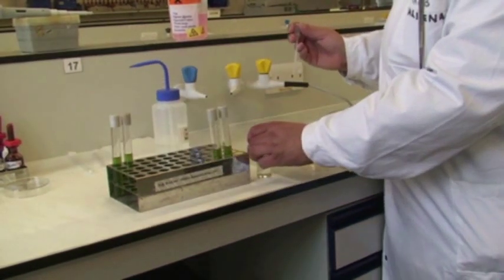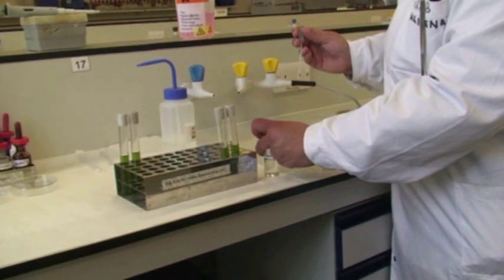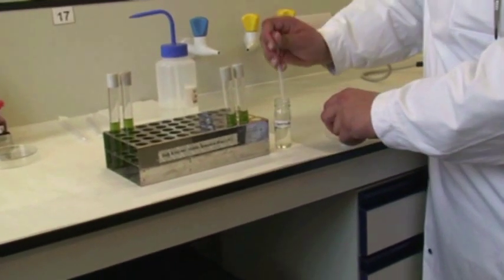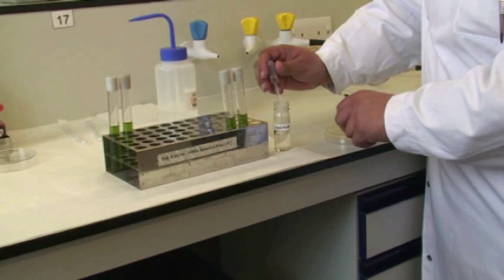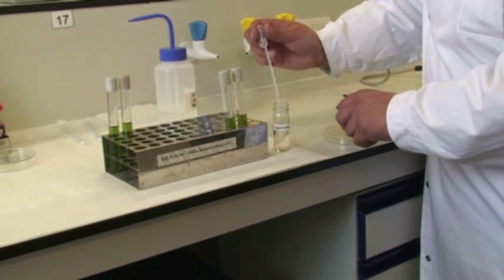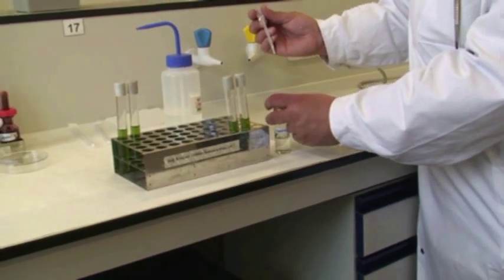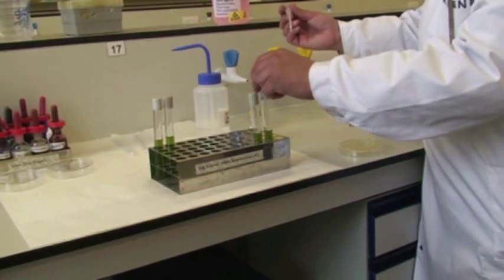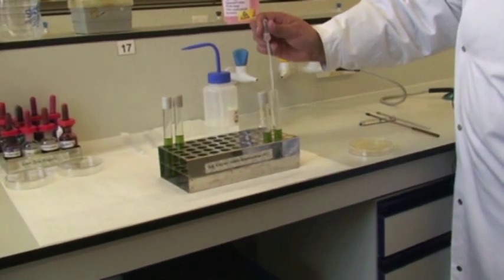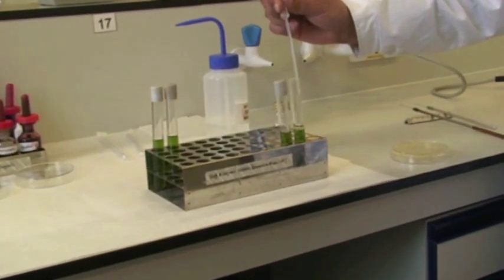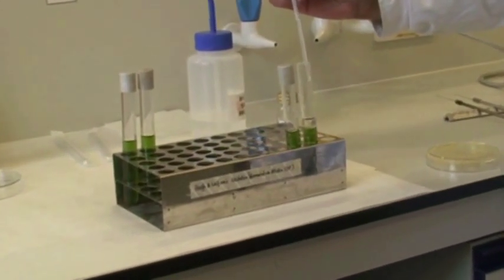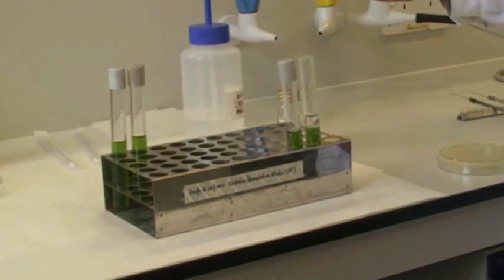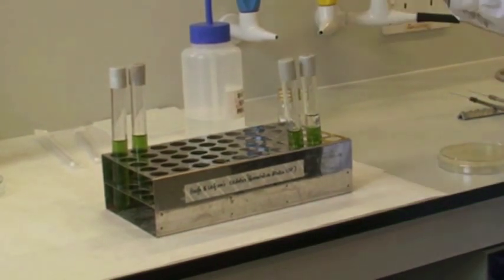So taking some liquid paraffin, probably needs about that much, and then just topping up one of those tubes with paraffin oil just to simulate anaerobic conditions. That would be sufficient paraffin oil there.